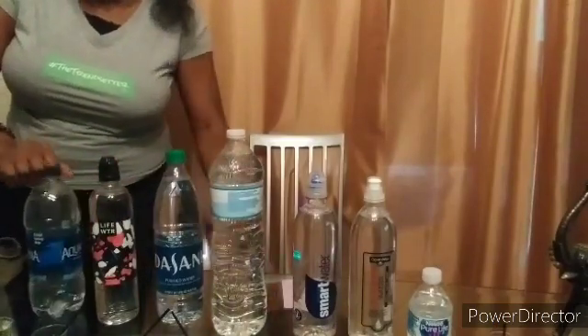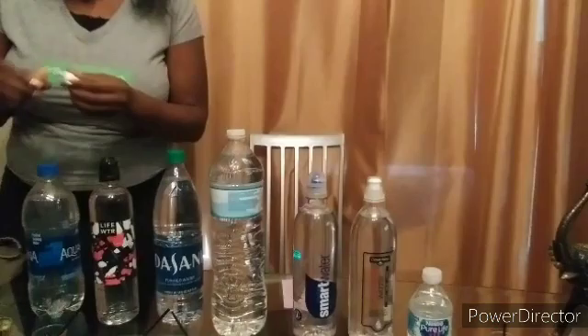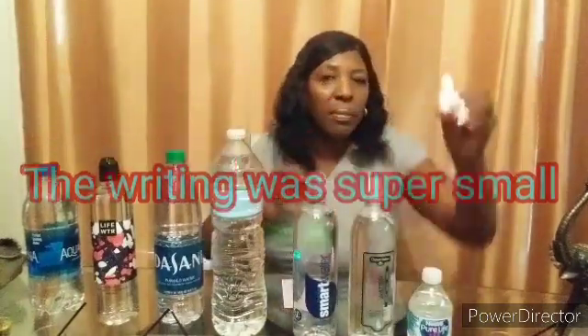Two drops: one, two, one, two. Let me stir it up. This is regular New York tap water, guys - that is bluish-green! I would say this is good. Oh my gosh, I cannot see the numbers on it but I will get you the numbers. But it's this color here - if you can see that.